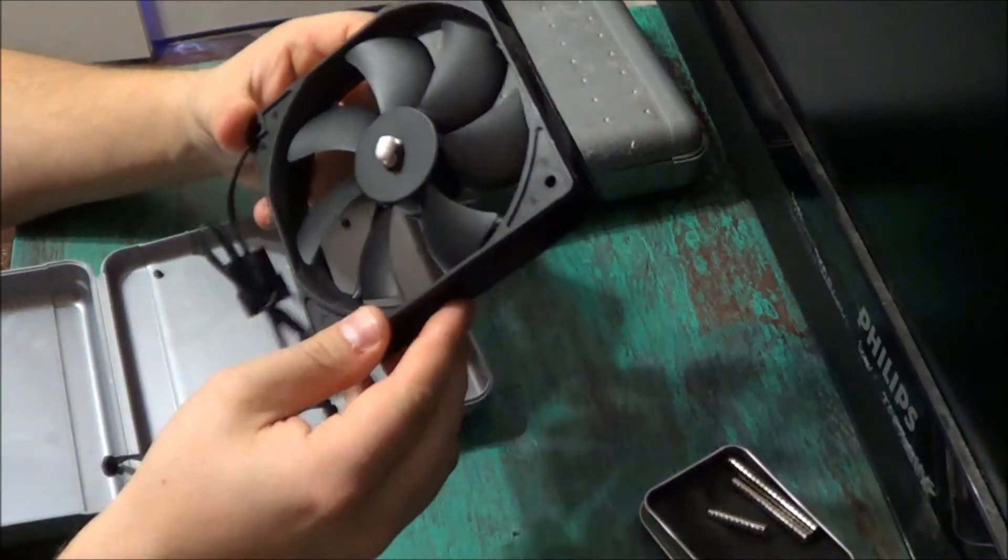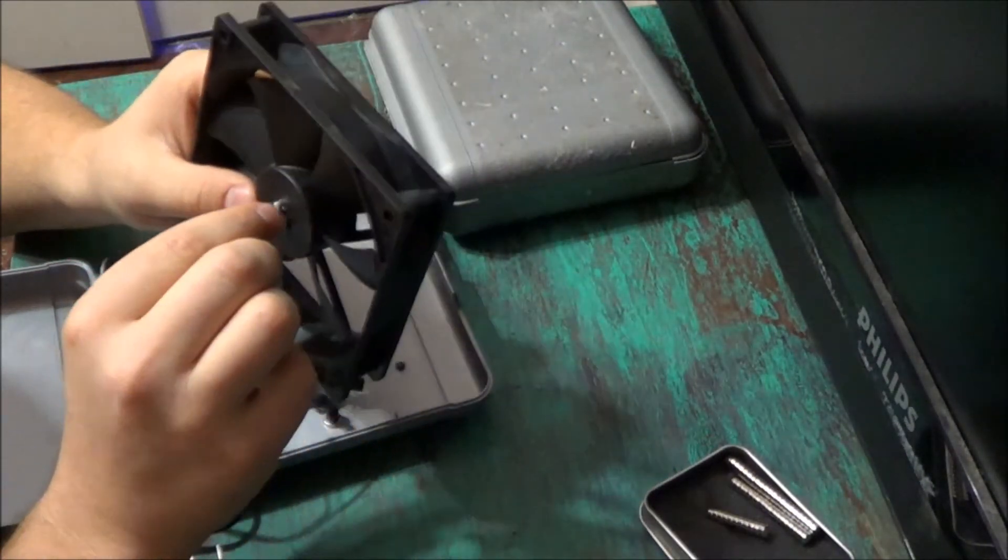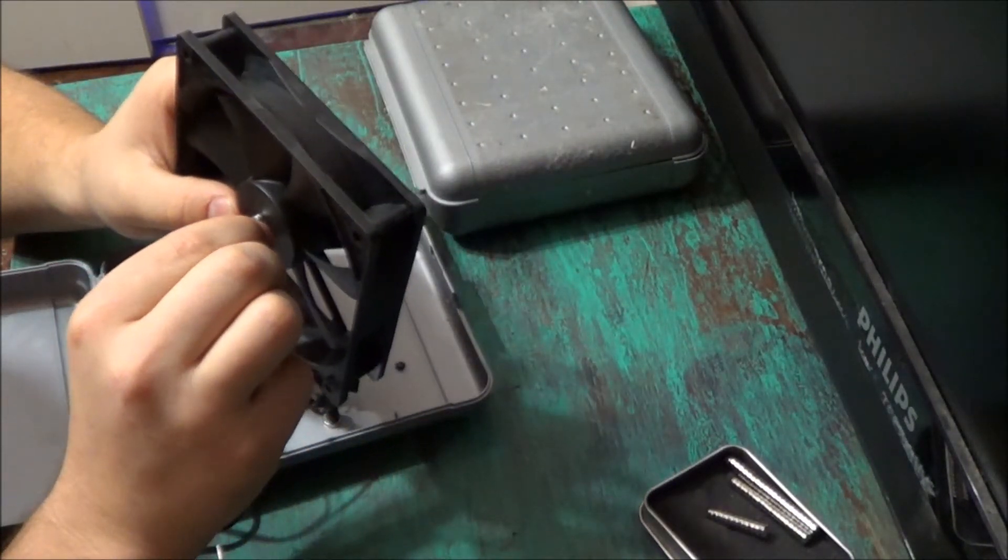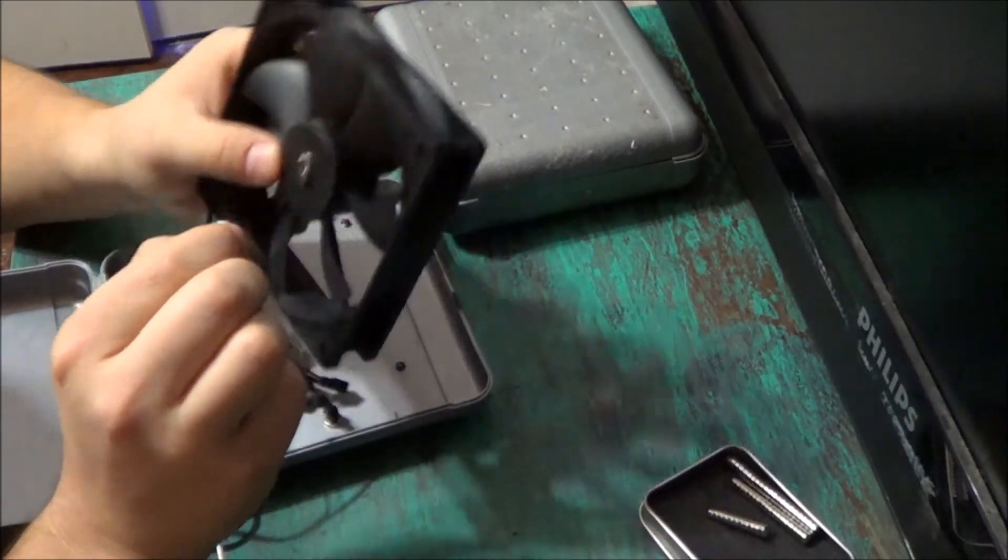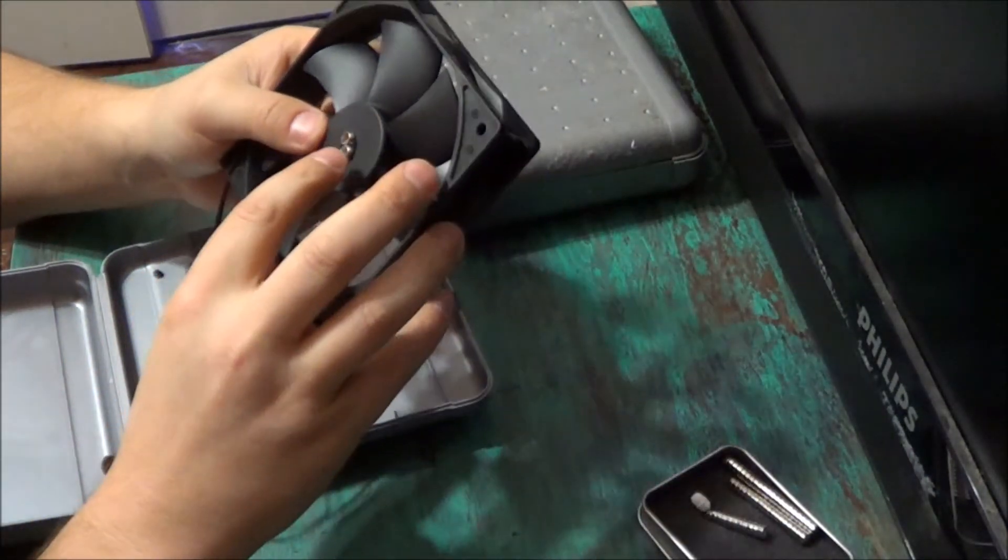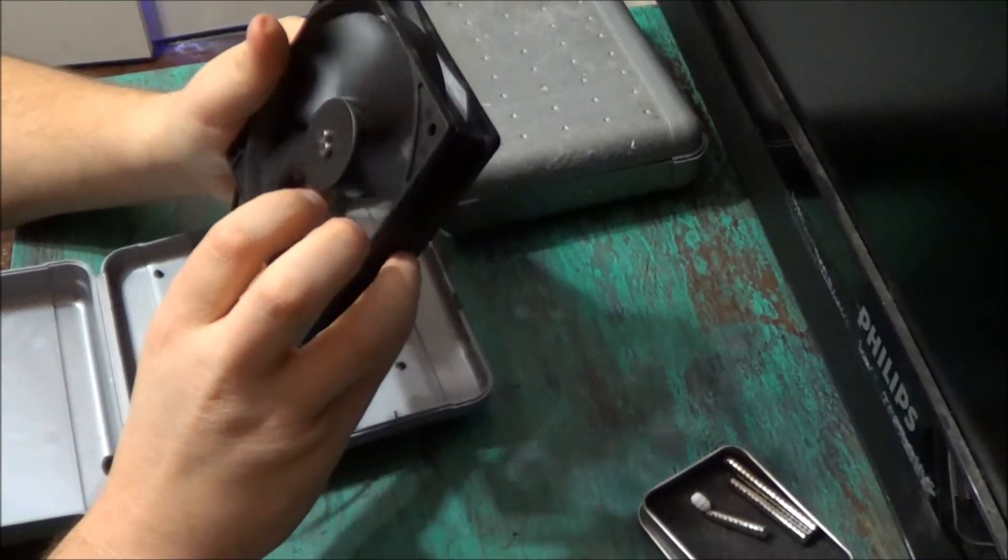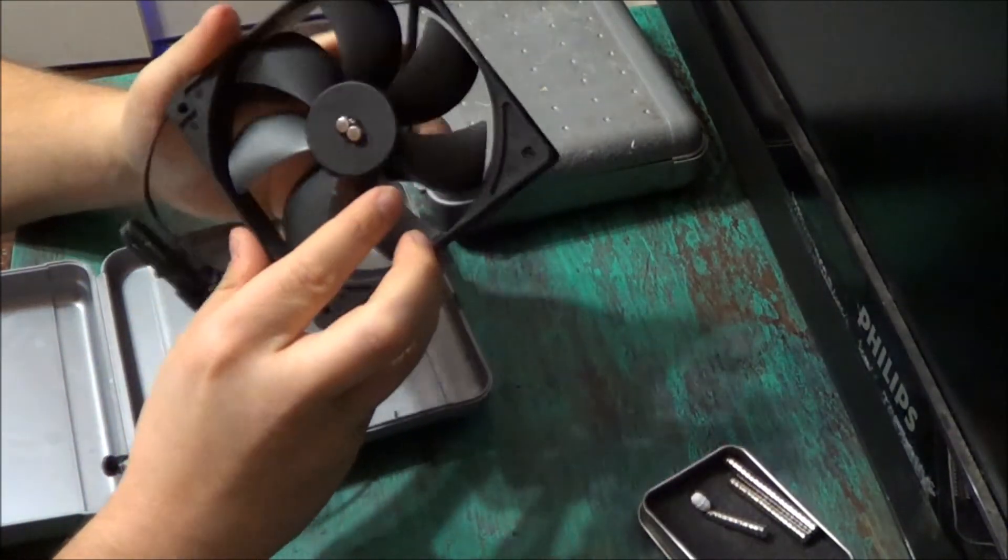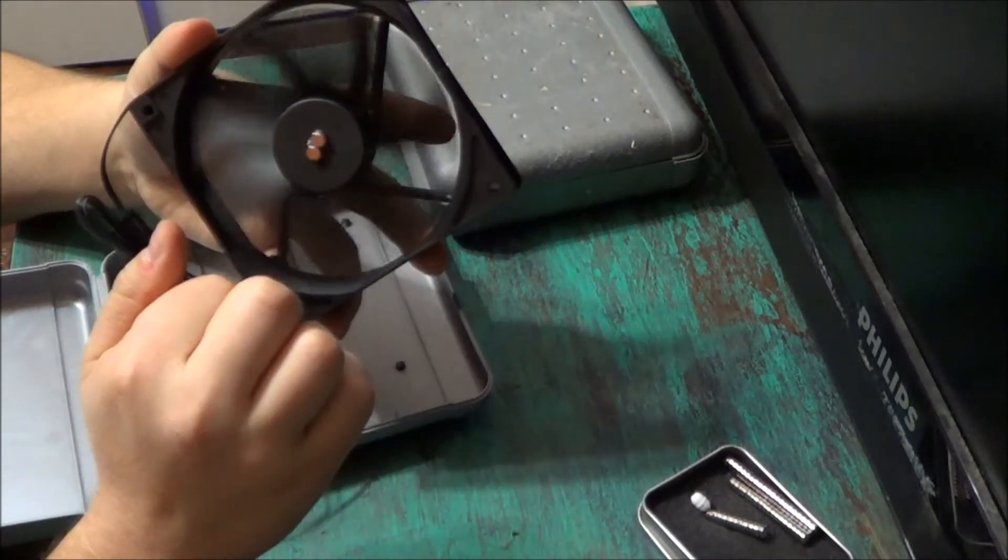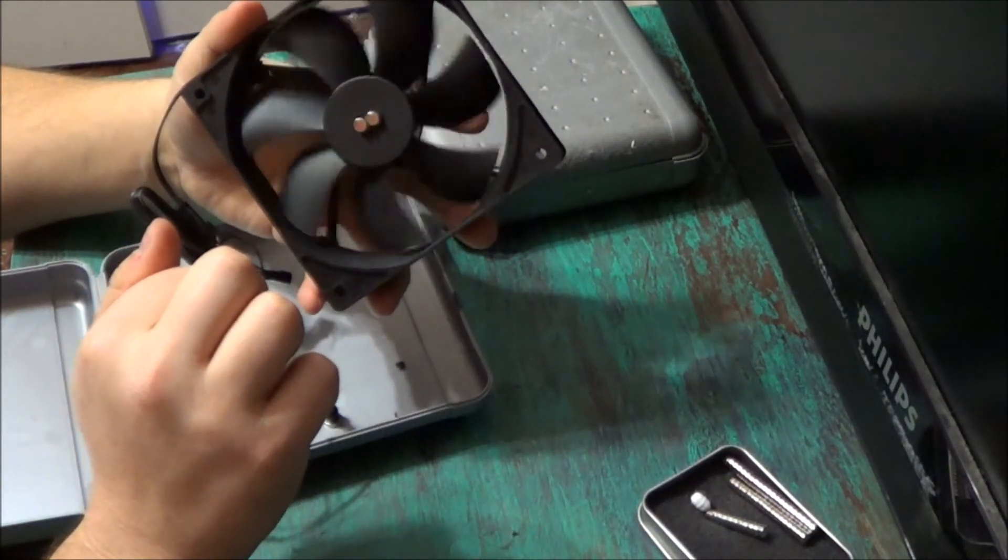Now we're going to bring our fan back out. And our magnets are dry on here now. They're not going to come off. They've had sufficient amount of time to dry.